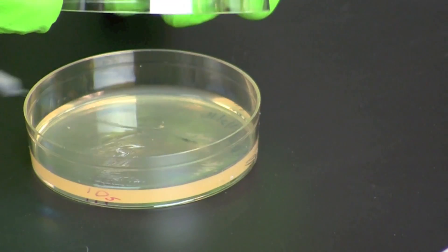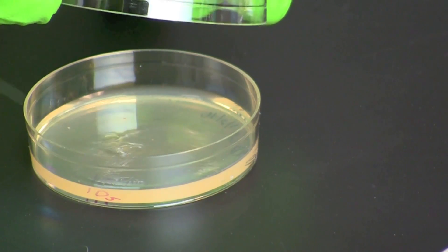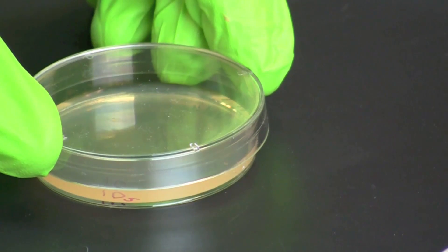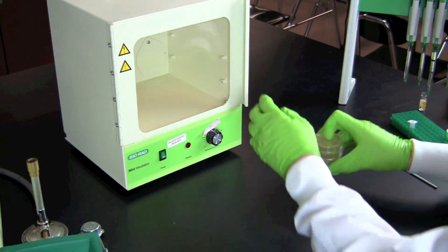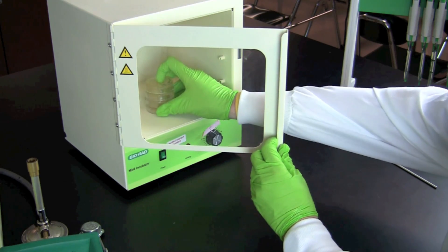Plate 100 microliters of each dilution on the matching plate as in this example. When finished, stack the plates upside down and place in an incubator at 37 degrees Celsius for 16 to 24 hours.